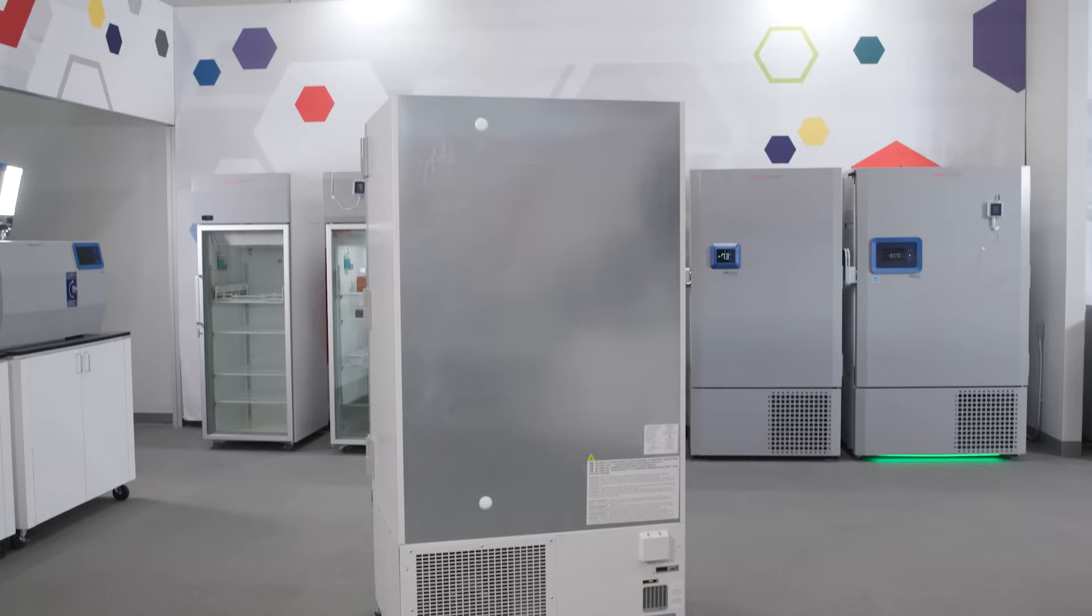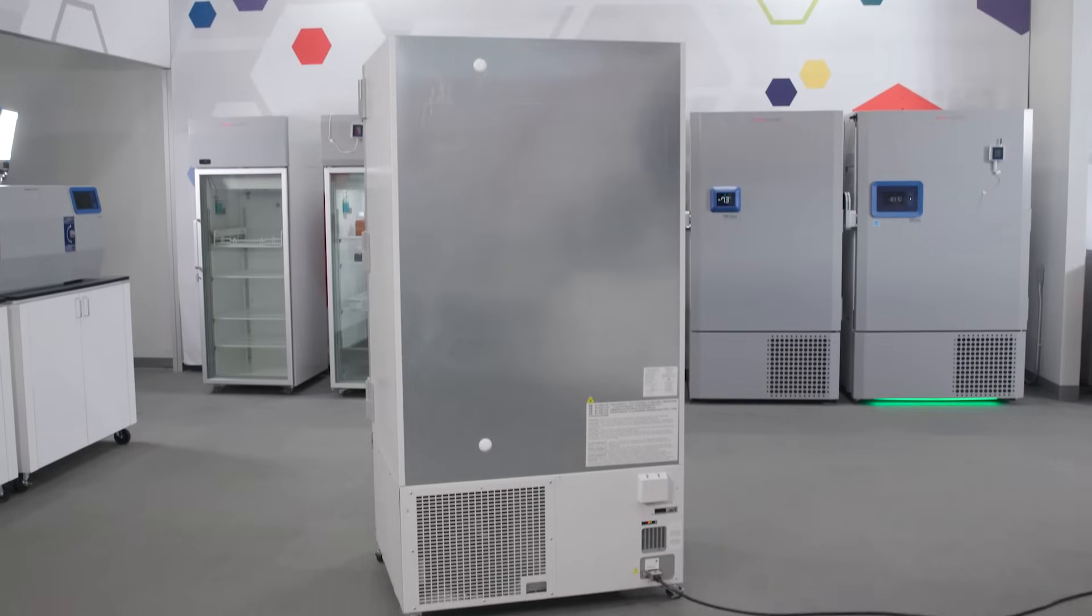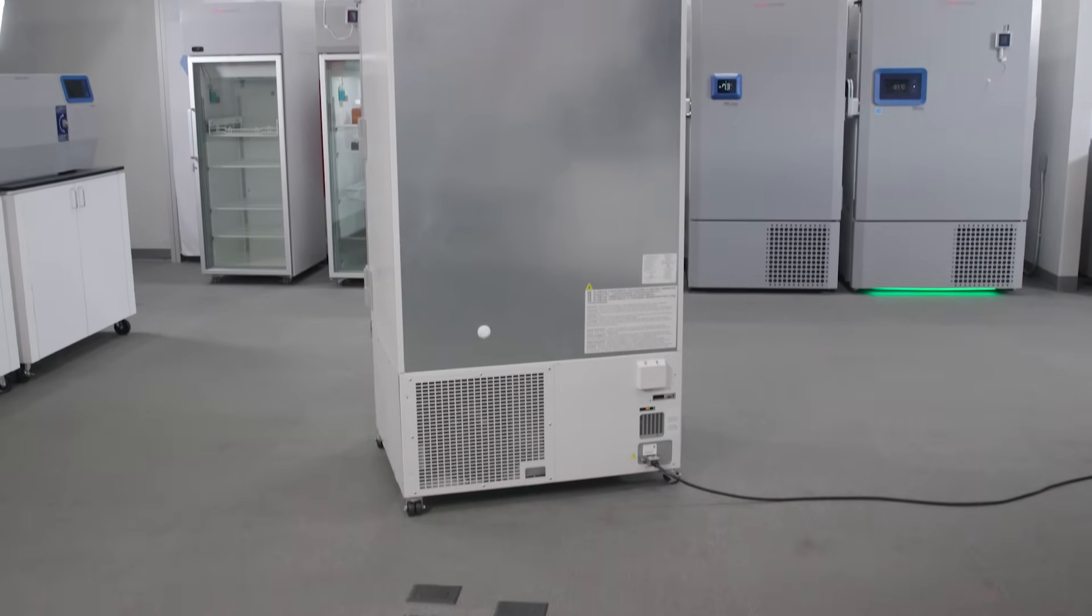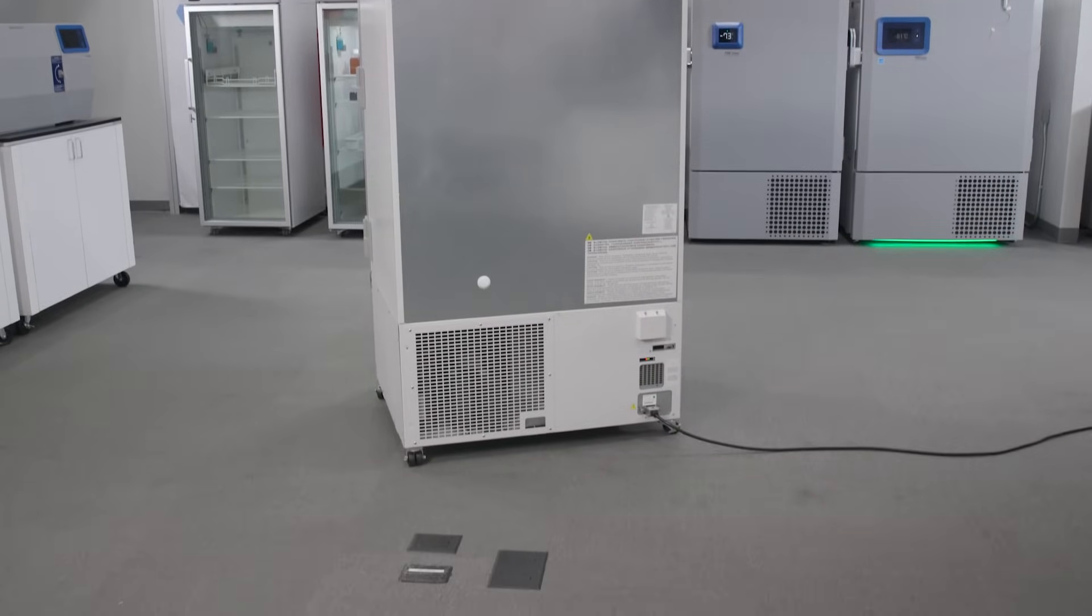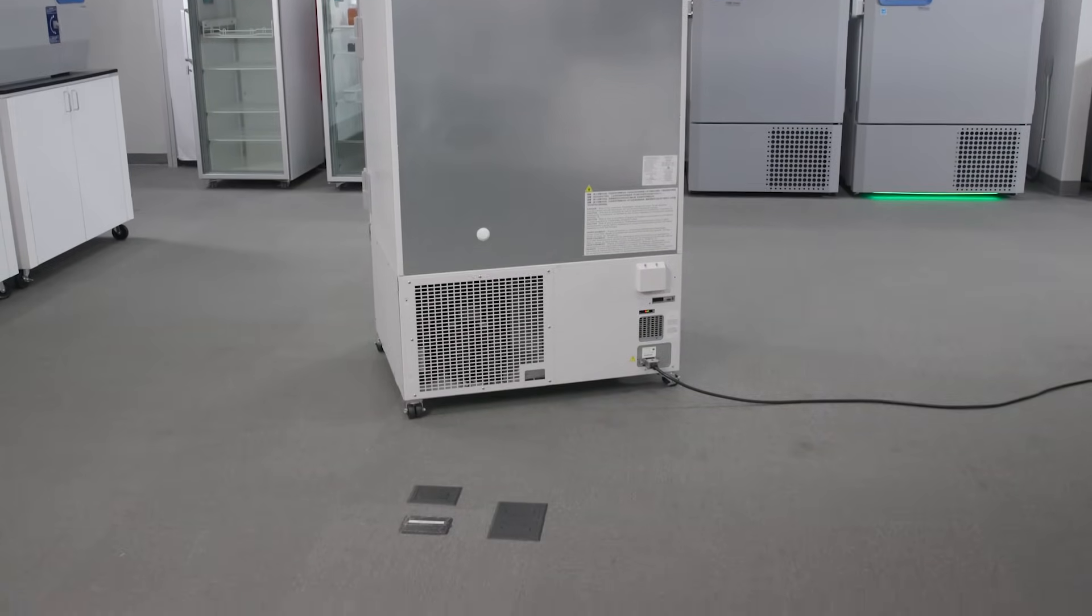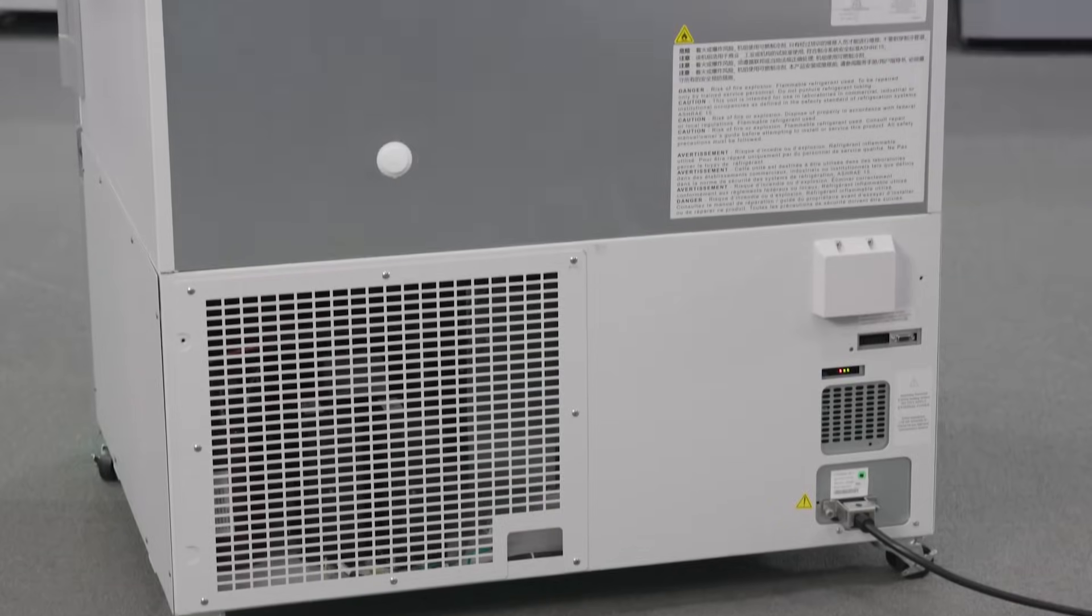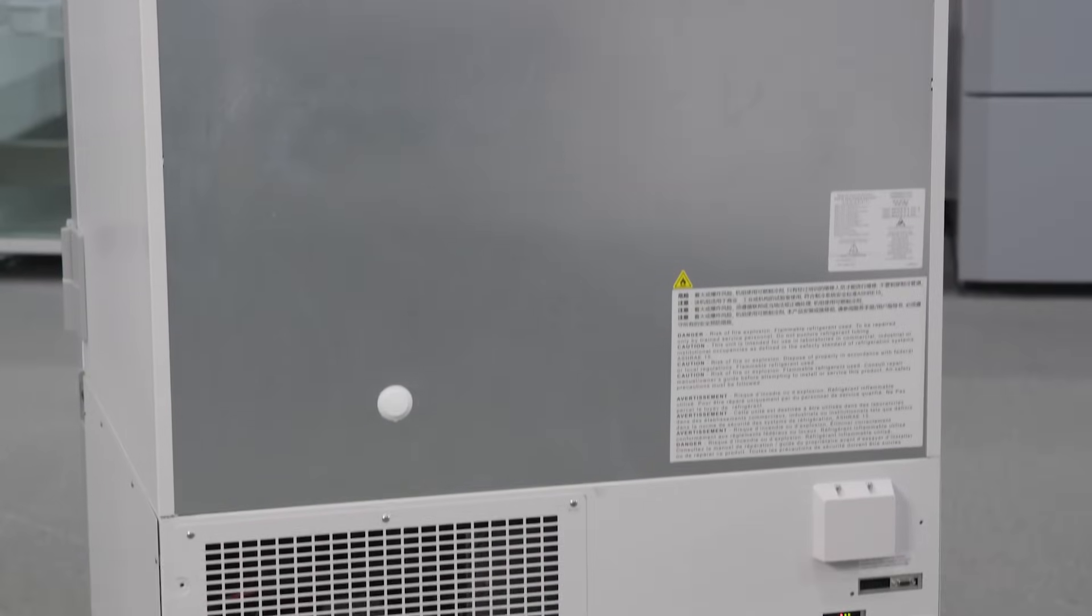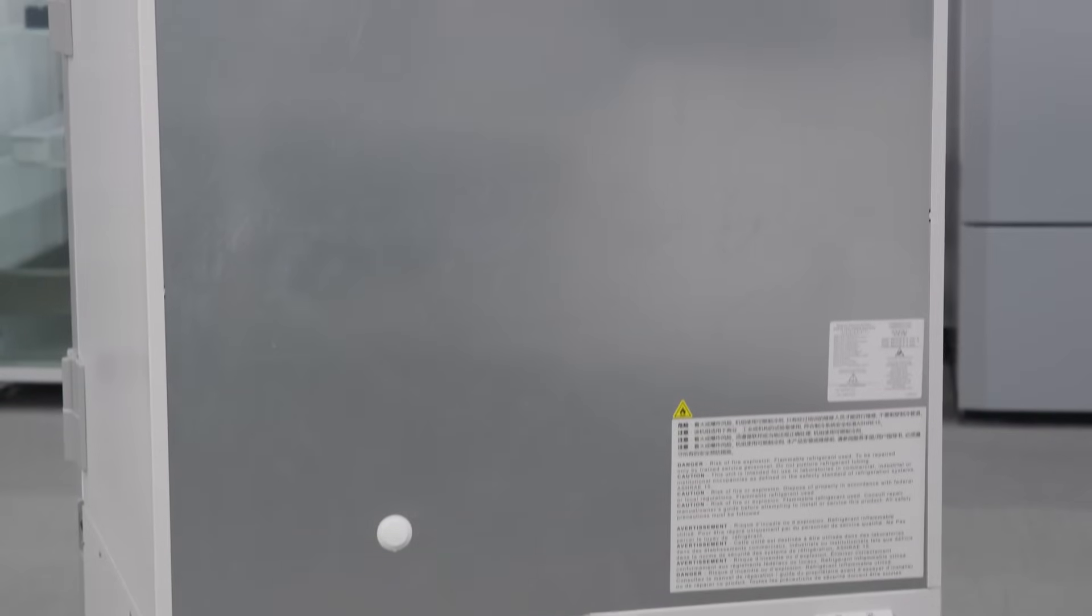Outlets can be a precious commodity in the lab, so the TSX Universal ULT Freezer provides a direct source to connect systems to a 5-volt DC power supply or to power over Ethernet or PoE.